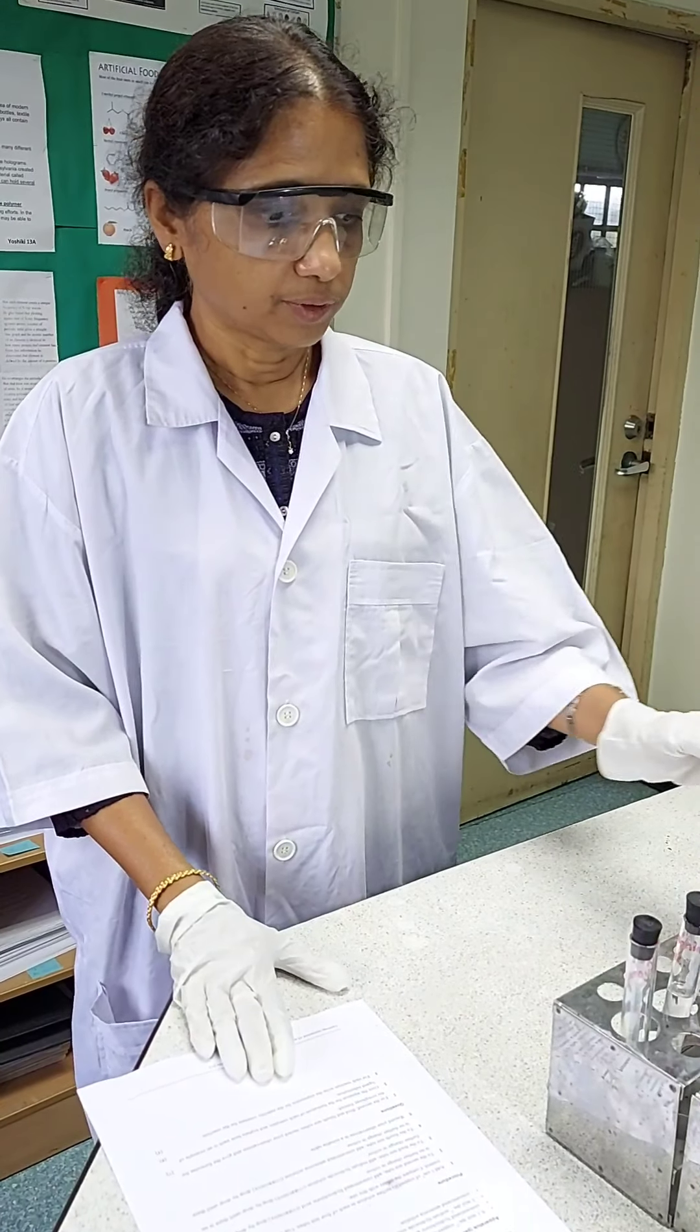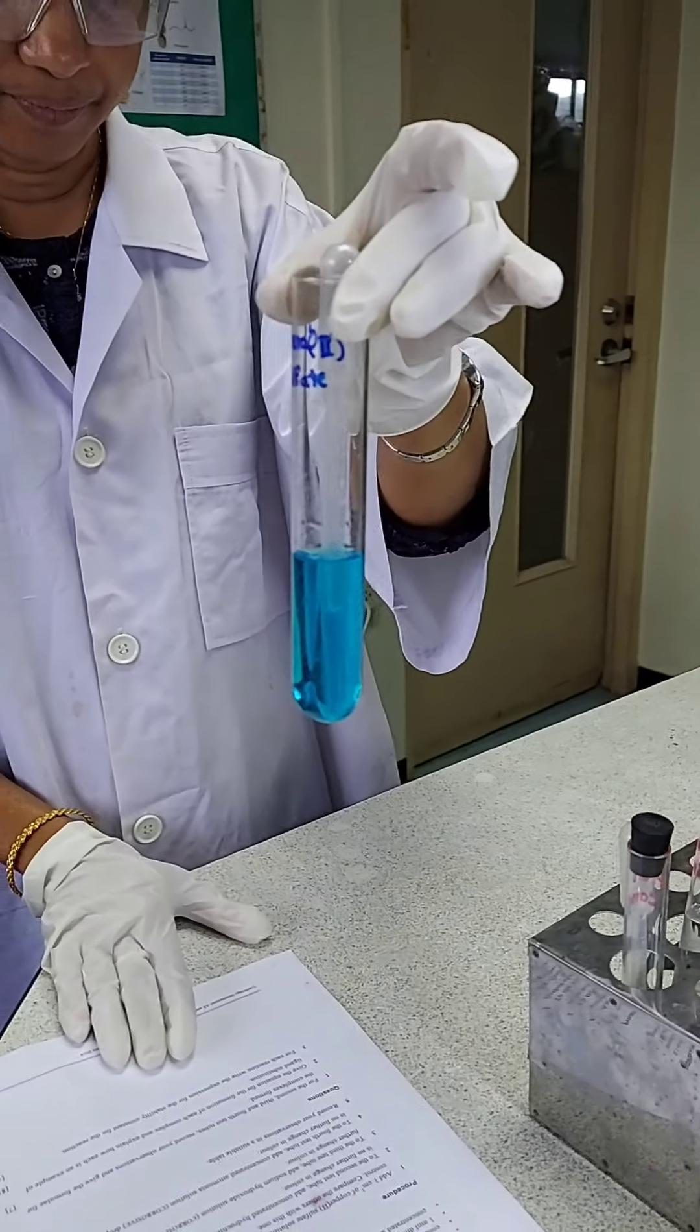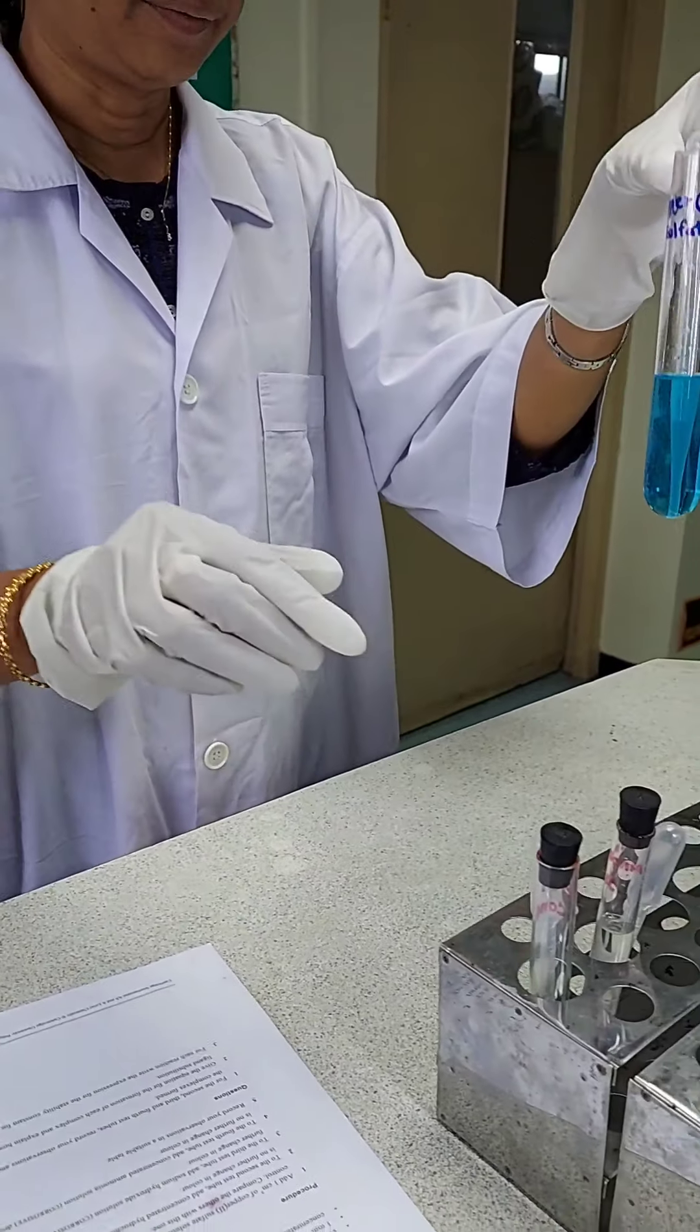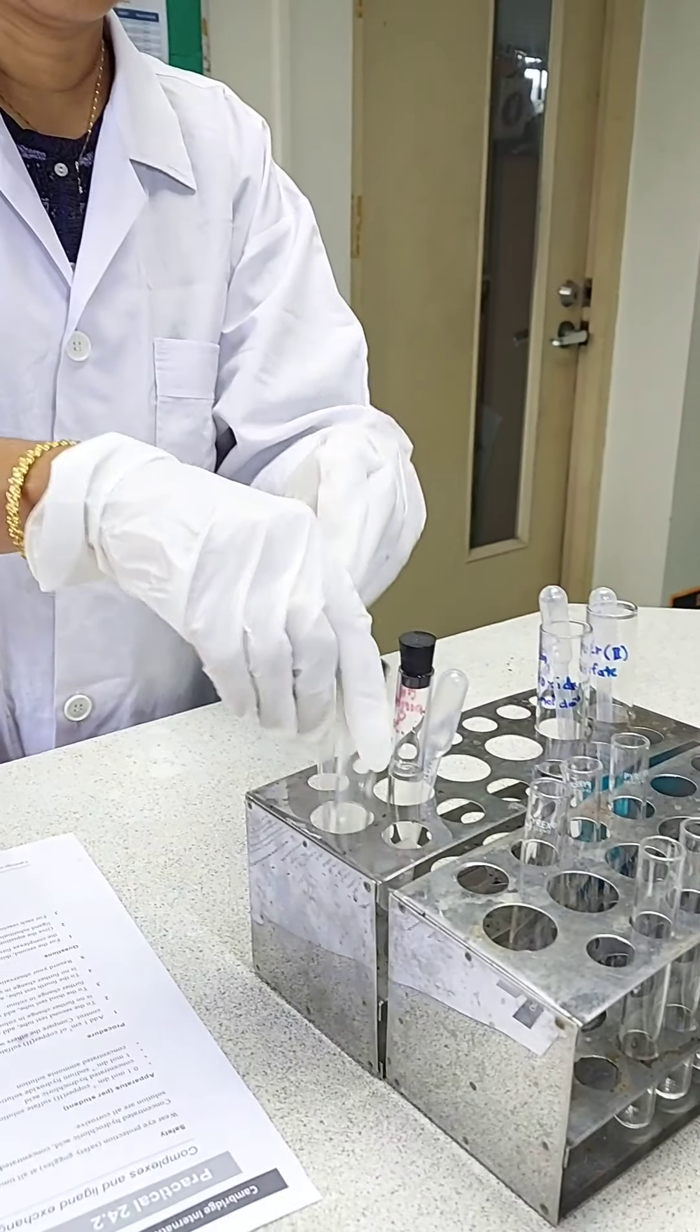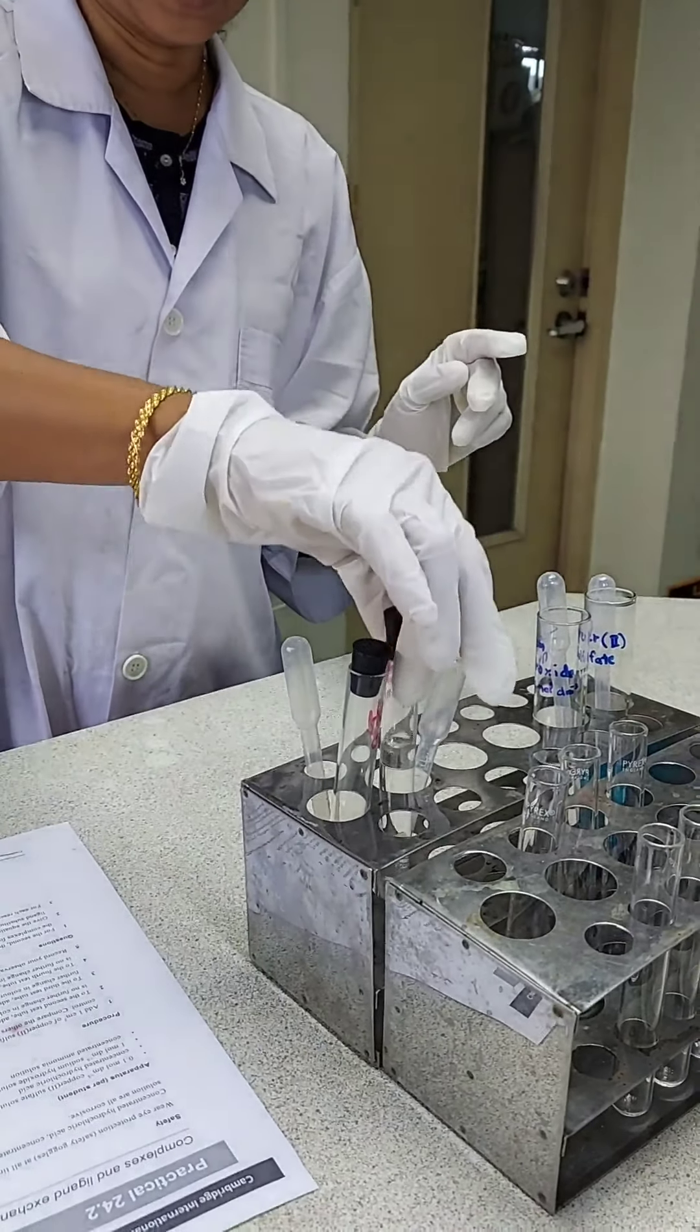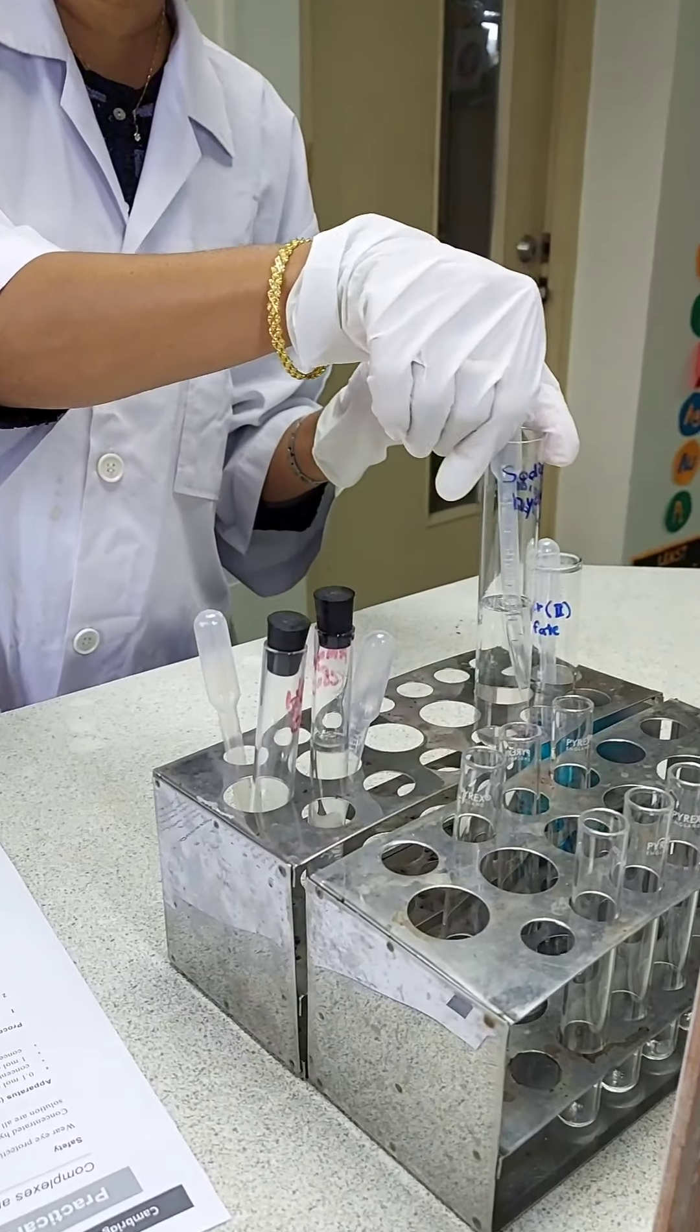For this experiment, we'll be using copper sulfate, concentrated hydrochloric acid, concentrated ammonia solution, and 1 mol per dm³ sodium hydroxide.